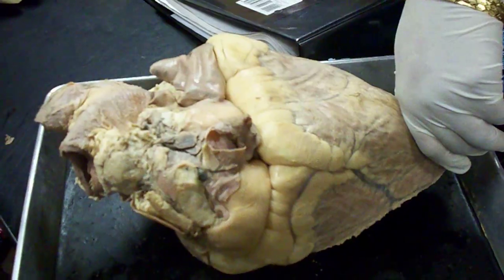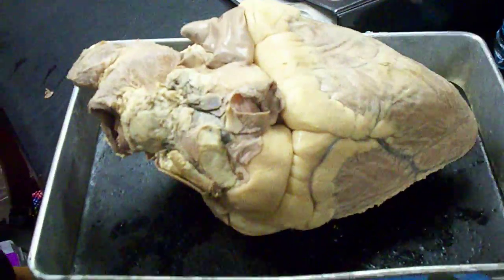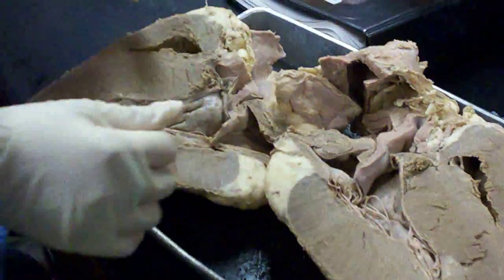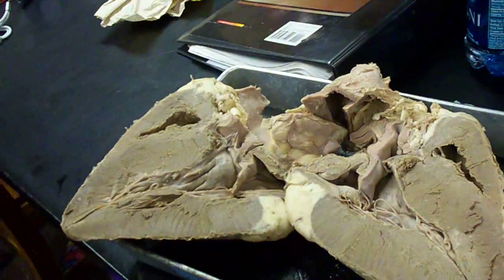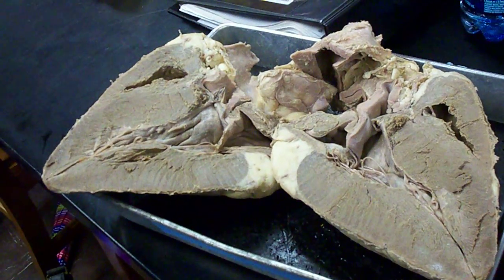I'm gonna identify some veins on the front of it. Left and right — semilunar valve. Does that say brachiocephalic? Or branches? What does that say? Aorta and branches. What branches?